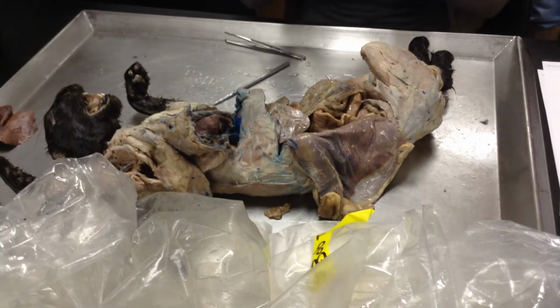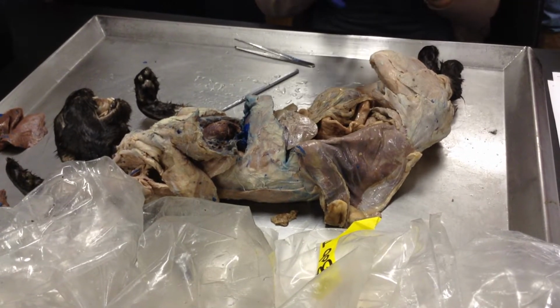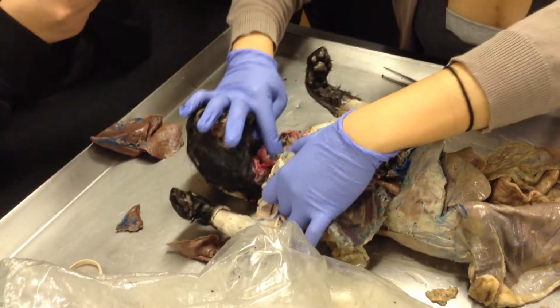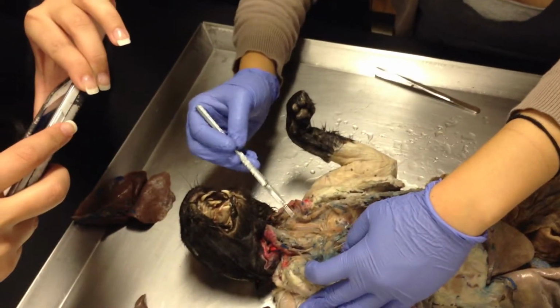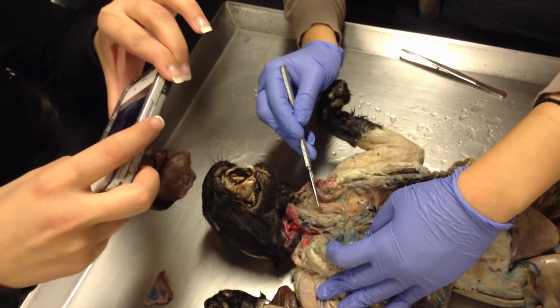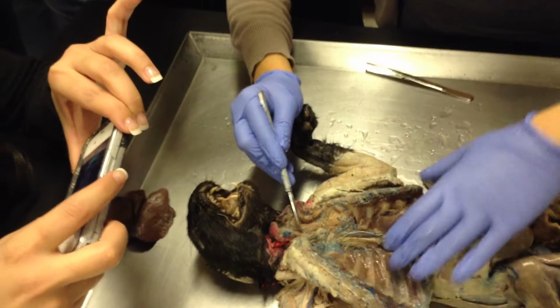And the esophagus, is it behind or in front of the trachea? Behind. It's behind the trachea, right? I could actually pin that structure if I move this guy over. Do you guys see this tube right here? Here's the trachea, and then this tube behind it. If I pin this, recall that's the esophagus. Pretty self-explanatory, very straightforward.